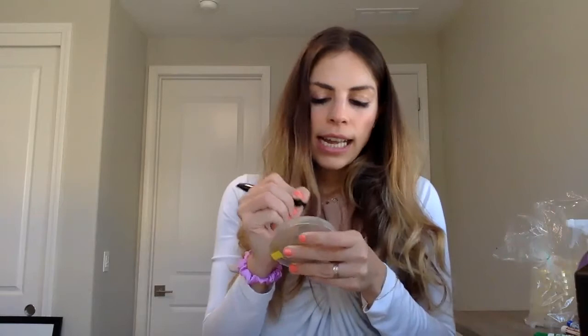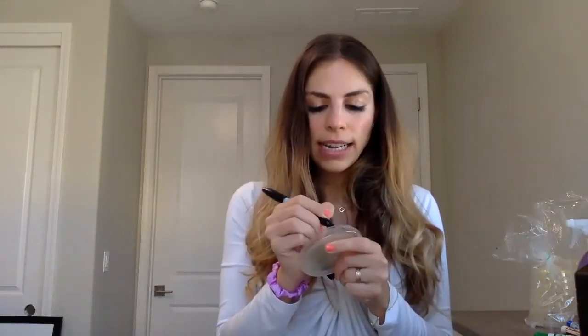And then what I'm going to do is what I always do, which is label your plates. So I'm going to put today's date on my plate and always label the sides. And that's basically all I'm doing. I'm just putting today's date on all of them. You can put your name on it, but you're home, so they're your plates.